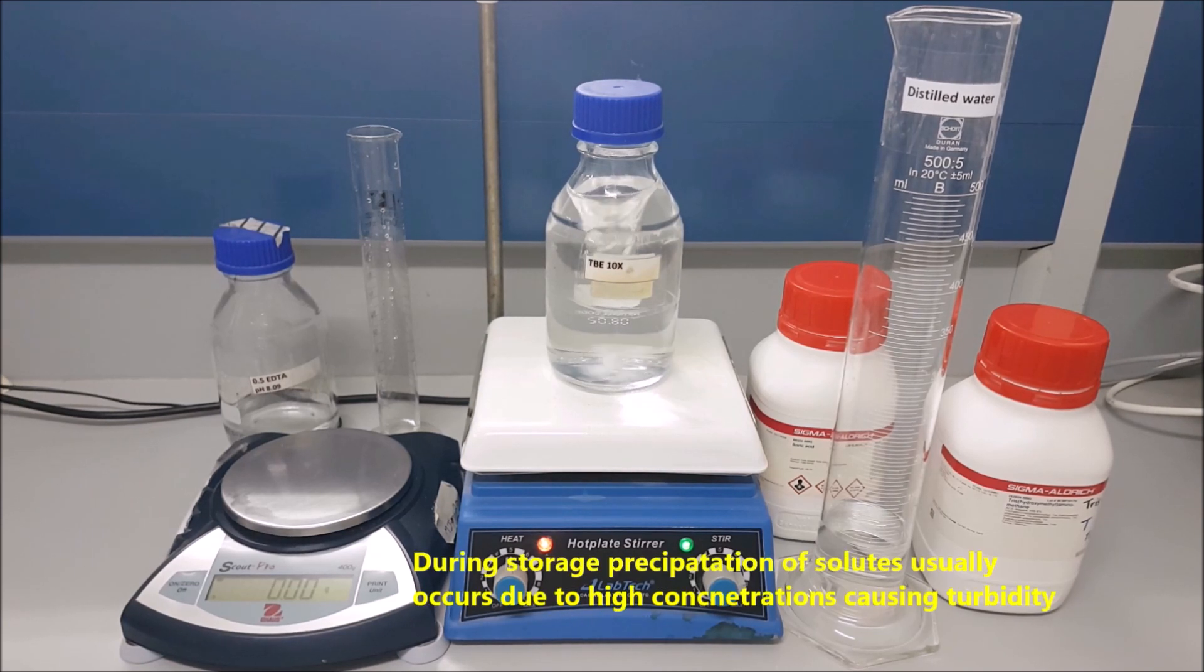During storage, precipitation of solutes usually occurs due to high concentrations, causing turbidity.